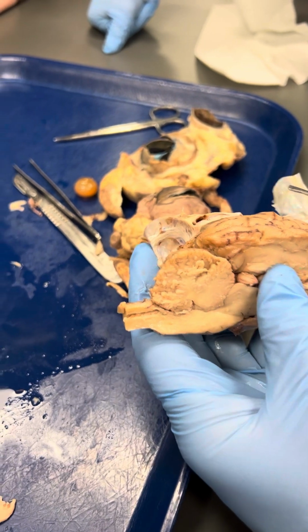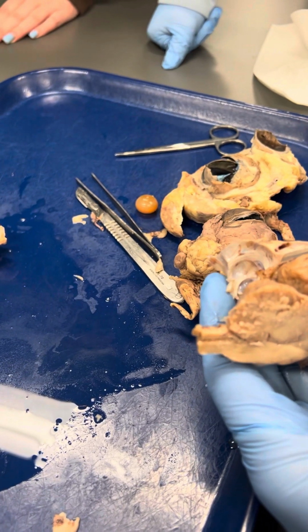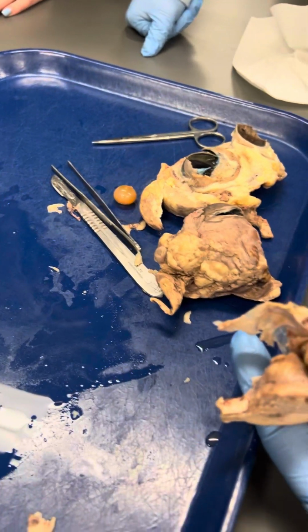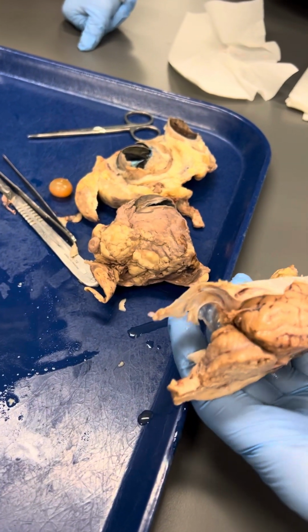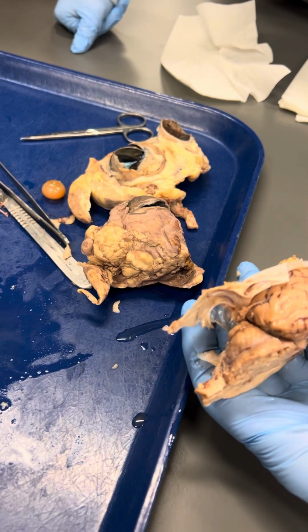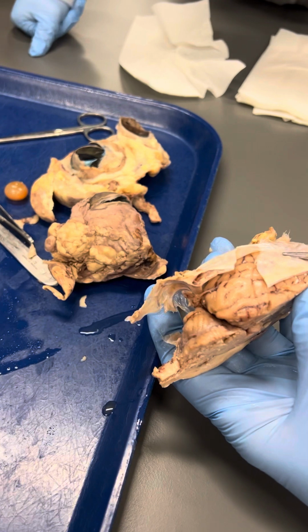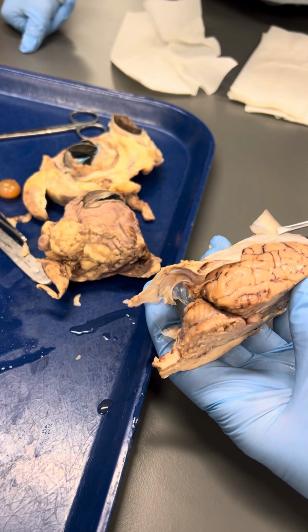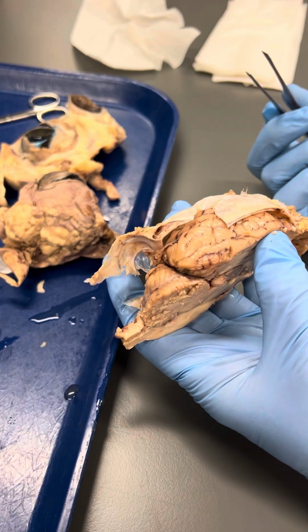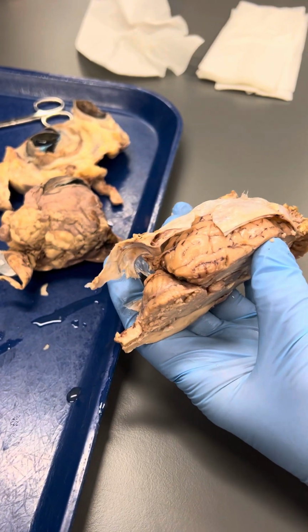We have to differentiate between those two very top layers. What would it be like? Probably like the pia. The pia you would have to know, and if I had it oriented like this and I had a pin on the top and a pin underneath, the dura is on top and the arachnoid is on this side. Okay. Gotcha. But you'll get that also from the lecture notes, what the order of the three are.